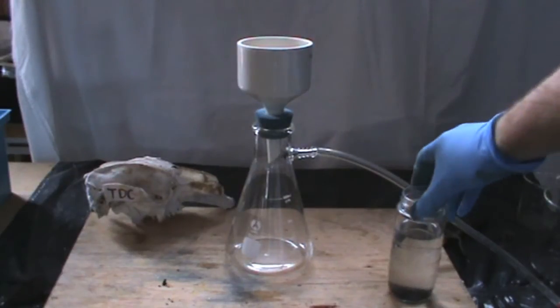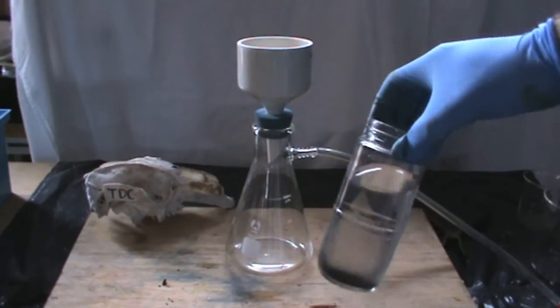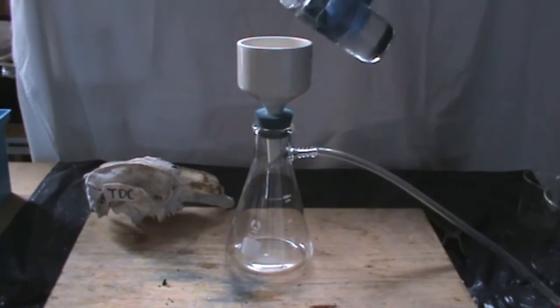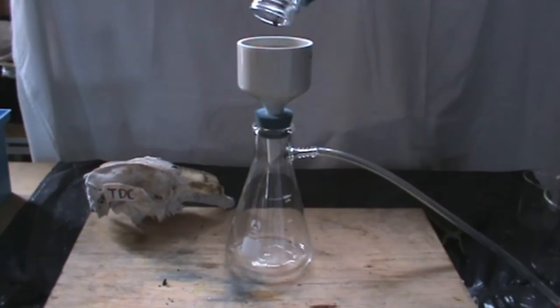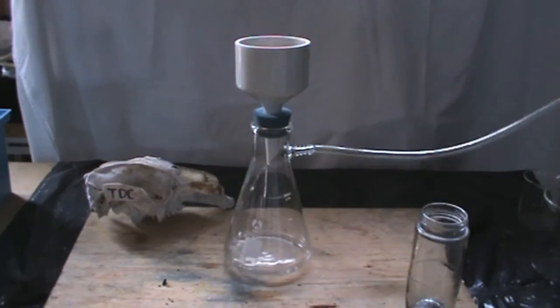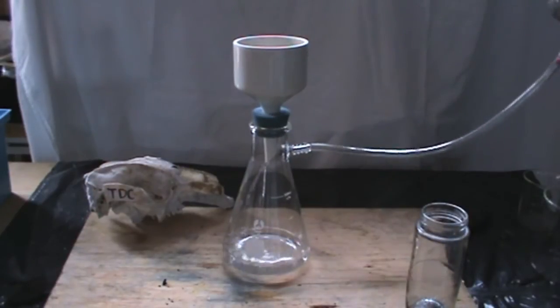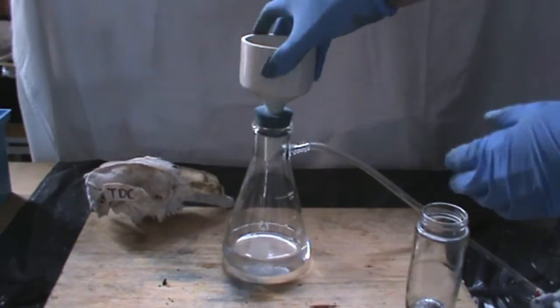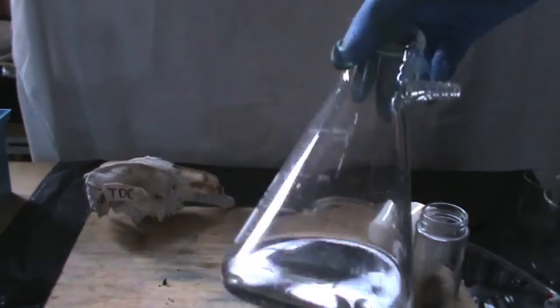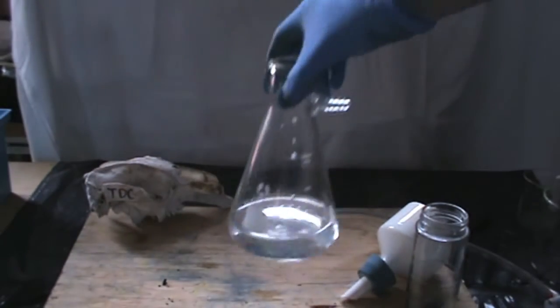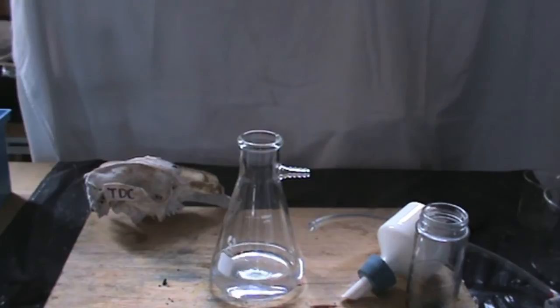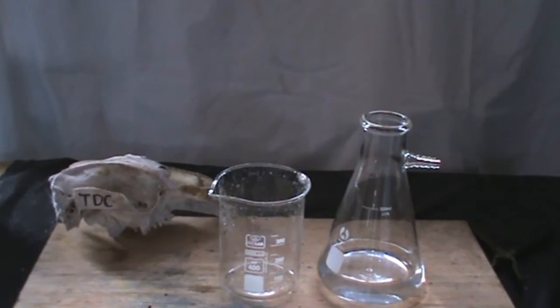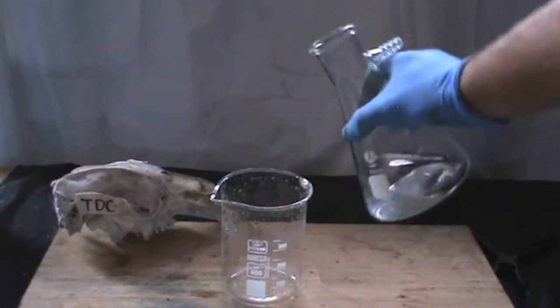Now we have to filter out any particles in the solution using a Buchner funnel connected to a vacuum pump. Get the filtered solution and pour it into a large beaker.